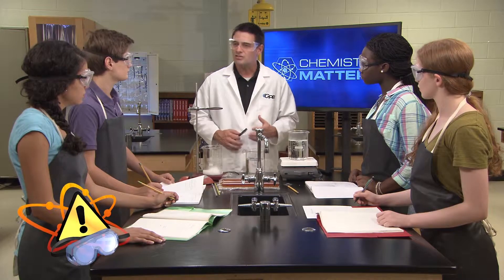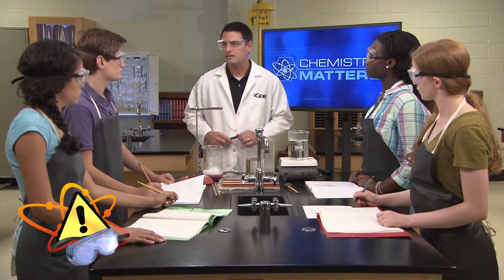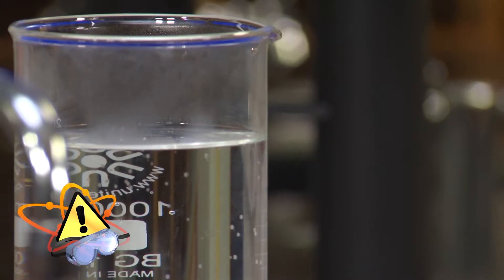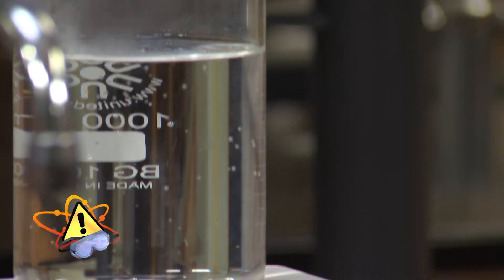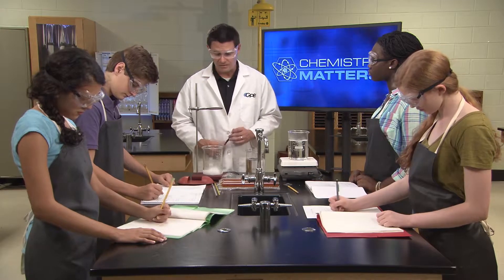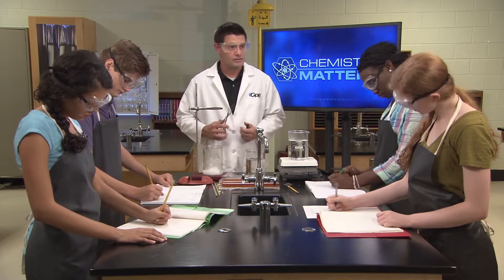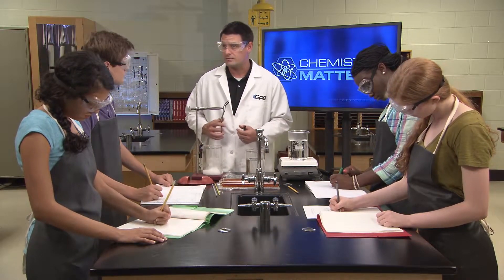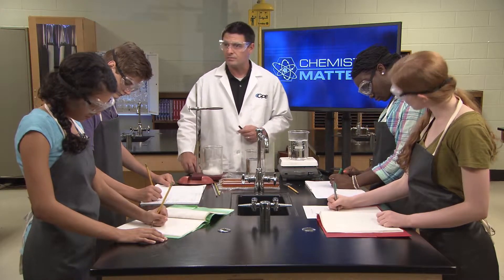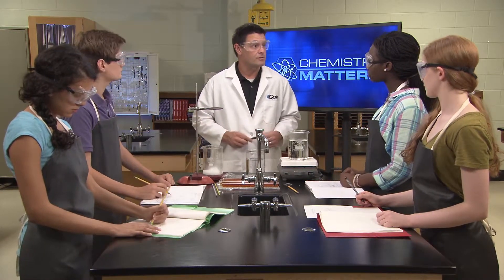Make sure that you always follow the safety procedures during the investigation. Anytime you're working with hot glassware or chemicals, you always have to have your safety glasses on. Please be careful handling the dry ice — you should always use crucible tongs when handling it, never your bare hands. And if glass gets broken at any point during the lab, you should step away from your lab station and call me over for help.